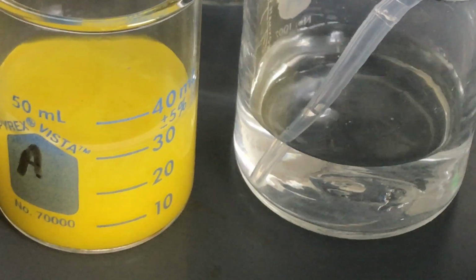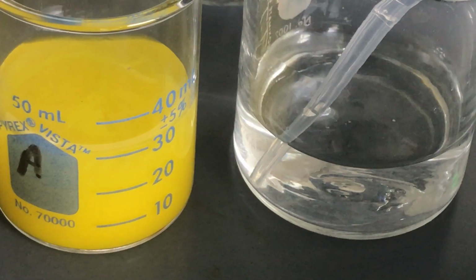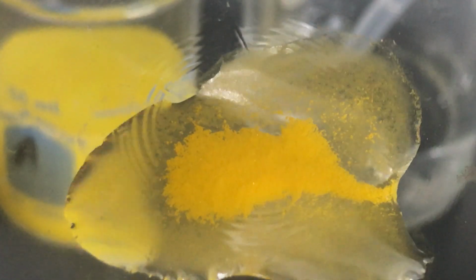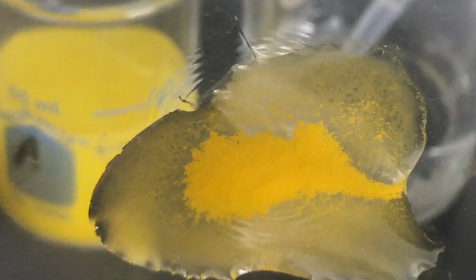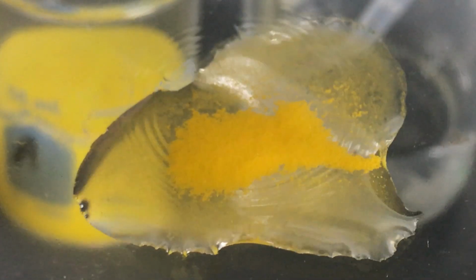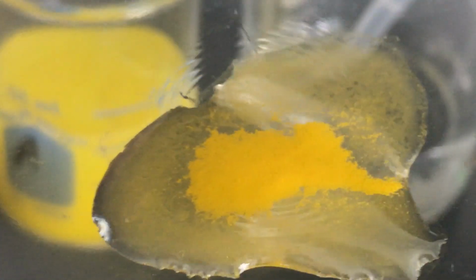They came together. Now, over time, I did another little small example on a little watch glass. You can see how the materials have started to settle because the watch glass is curved down. So we have what looks like a powder in the bottom. We still have some that's all the way around, and eventually that would kind of settle down to the middle, especially if I spun it around a little bit. But we still have some clear liquid, and that clear liquid is still going to be the rest of the residue of not only the potassium and the nitrate, but also some of the original water that is there as well.